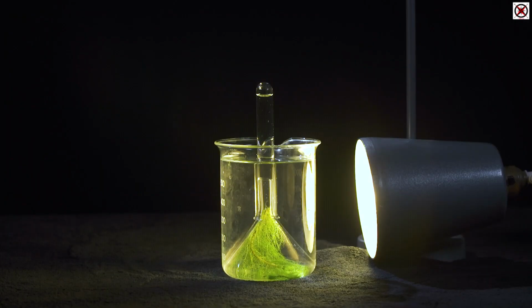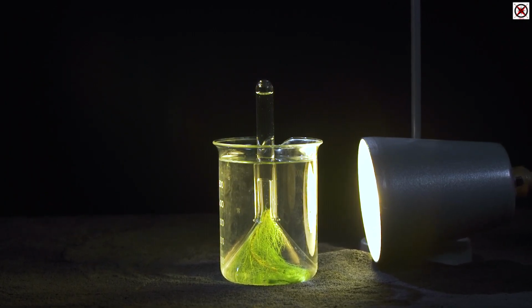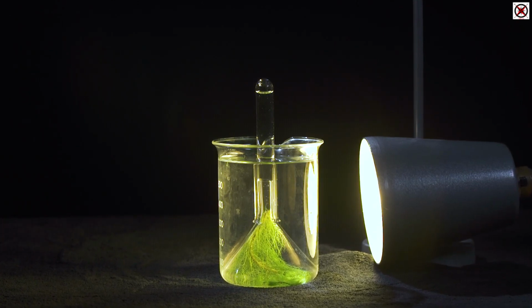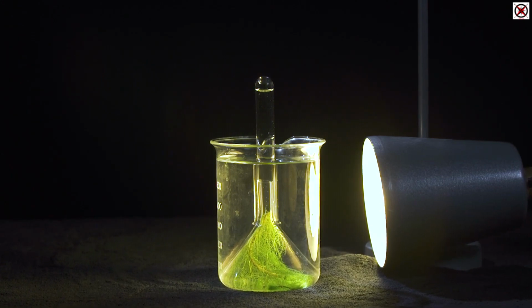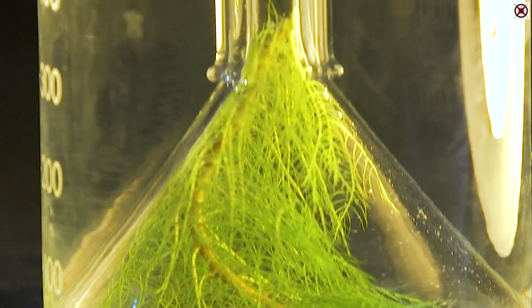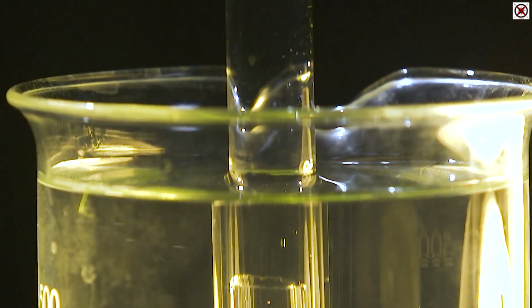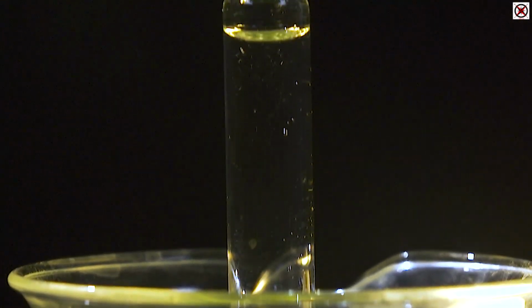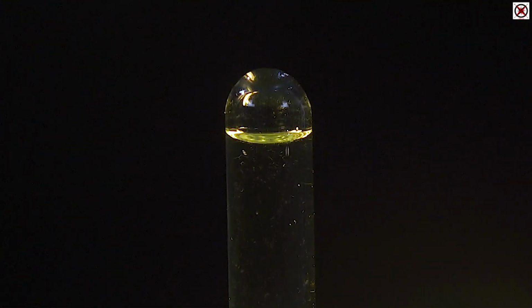This practical activity will be familiar to many people. A piece of pondweed, an aquatic plant, is turned upside down in some sodium hydrogen carbonate solution and placed next to a bright light. As the pondweed photosynthesizes, the gases produced are released from the end of the stem as bubbles. In the setup here, a funnel and test tube are being used to collect the gas that has been produced.